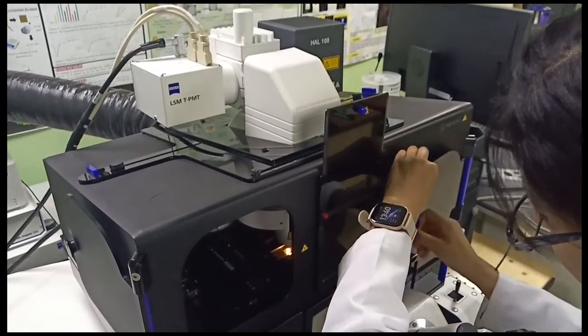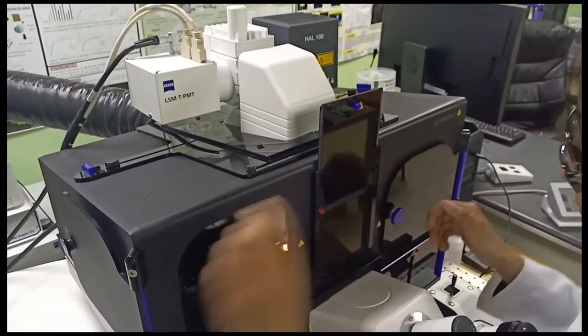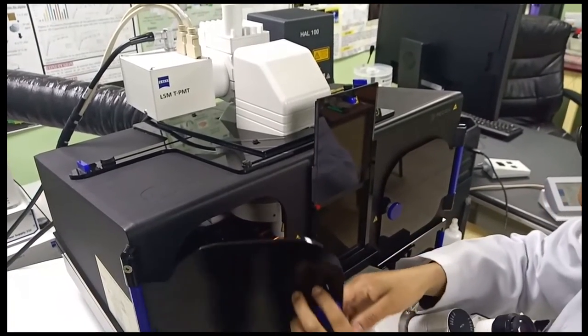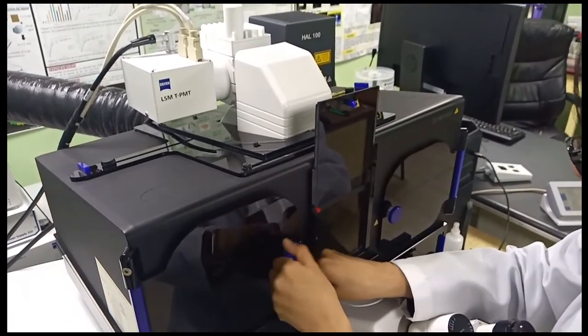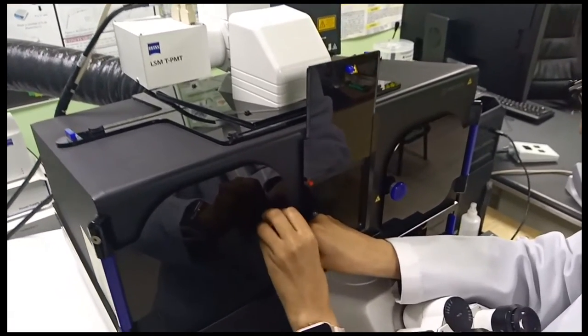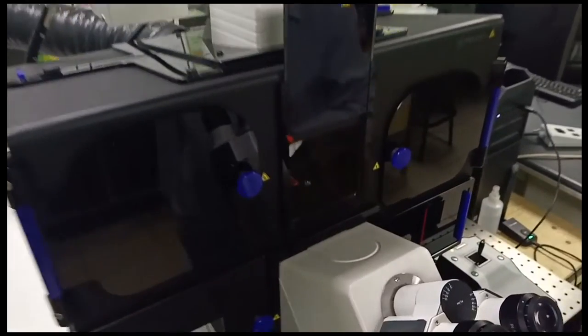The same mechanism as the vertical microscope: we can see the sample through the binoculars. We can move the sample using a joystick on the right part of the microscope, but normally the sample can be seen from this part. So now in the software we turn off the light and we choose the acquisition mode.